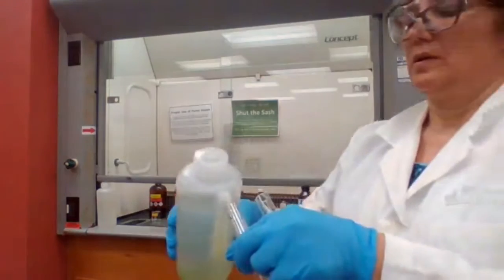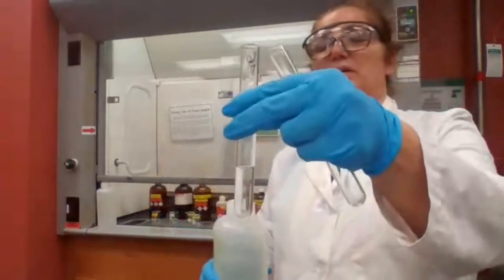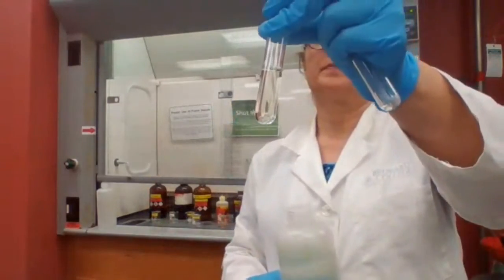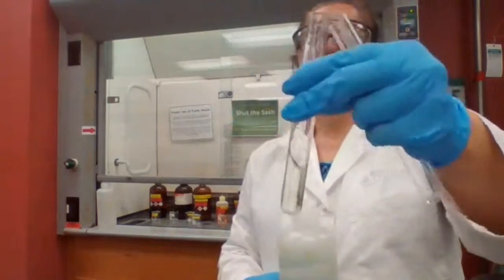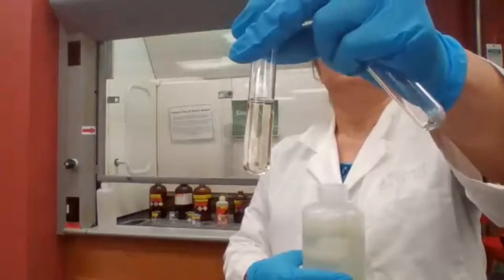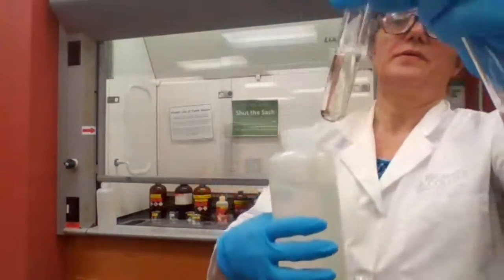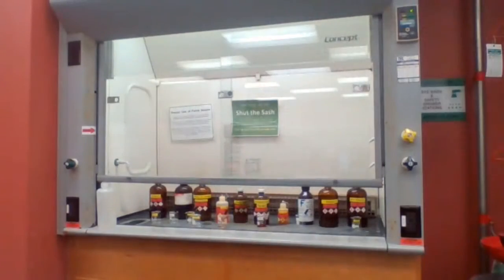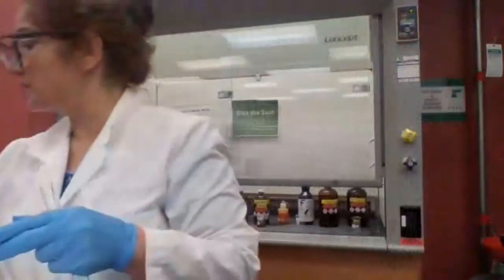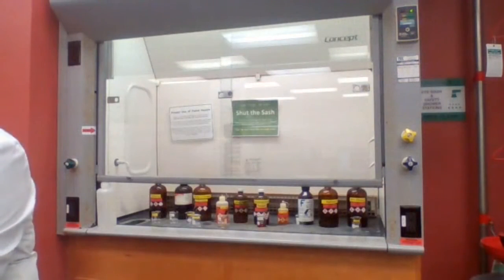So the first solubility test is phenol in water. It stays insoluble, or is slightly soluble, because it didn't dissolve. So that was the first test result. For those of you who are idle, come back and record your data, please.